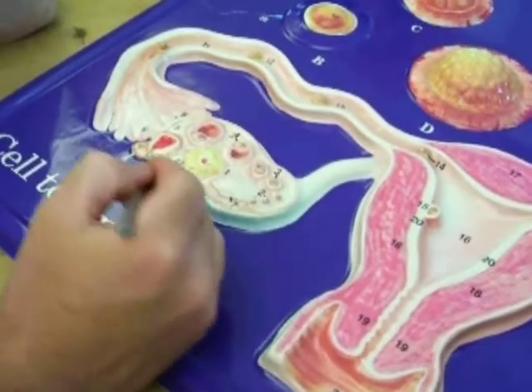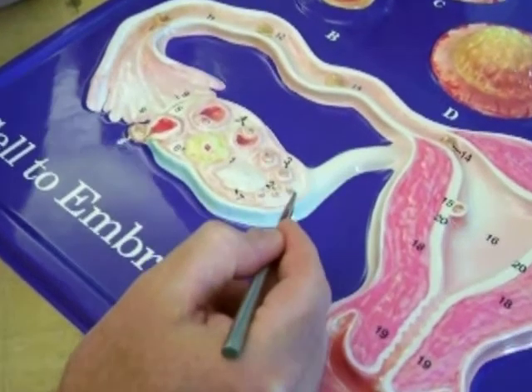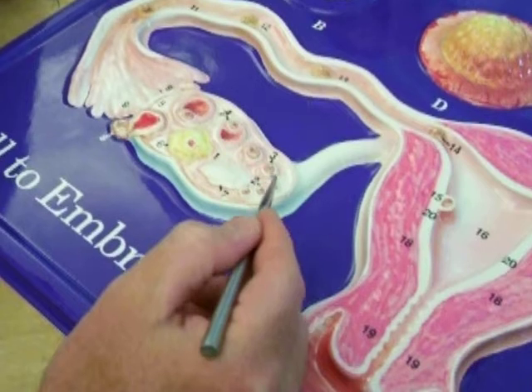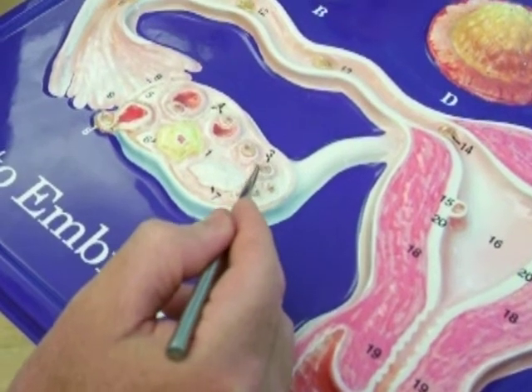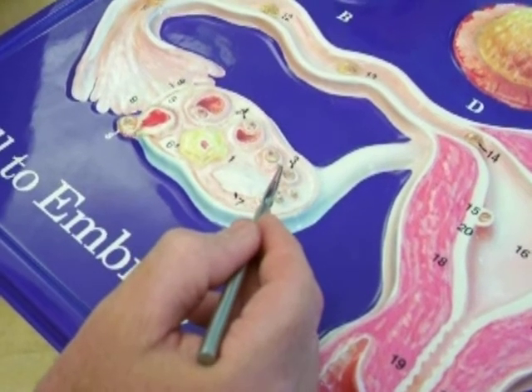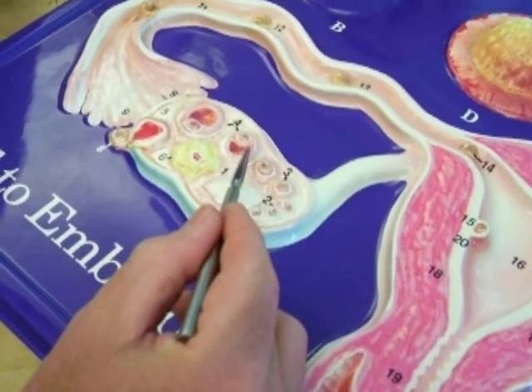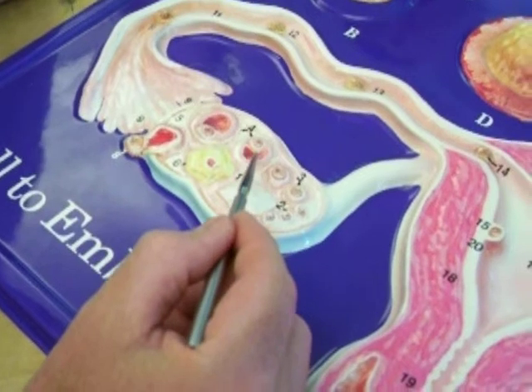You can see the ovary right here. And what they're representing in the ovary, these primordial follicles, because they only have maybe 1, 2 layers of cells at best. Then when they have multiple layers, 2 to 3, 3, 4, it becomes a primary follicle. You can see this is also a primary follicle. It will become secondary when it not only has multiple layers of cells, but it starts developing this thing called an antrum. So I would call this a secondary follicle.